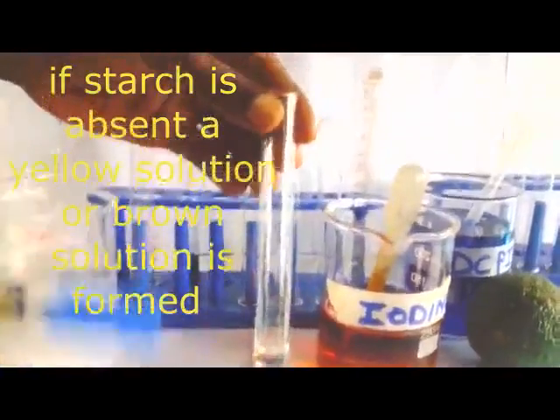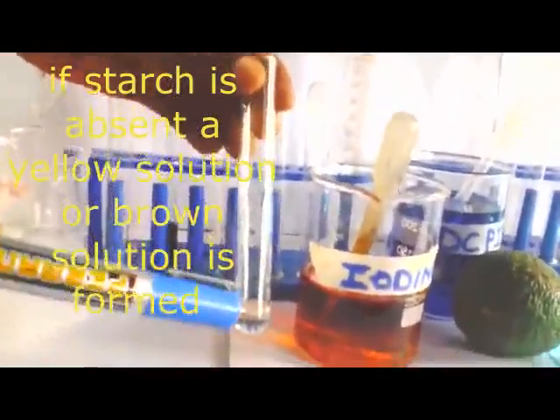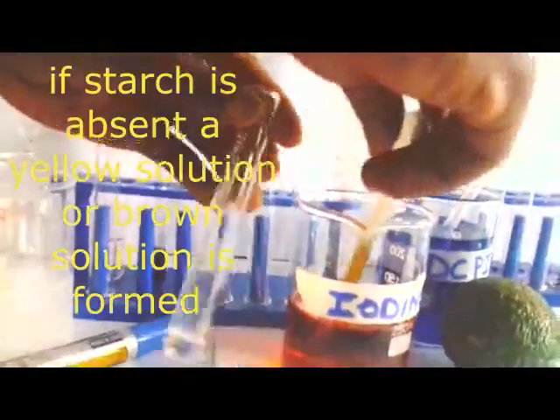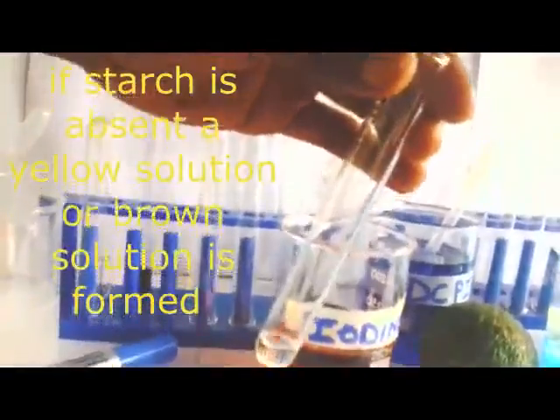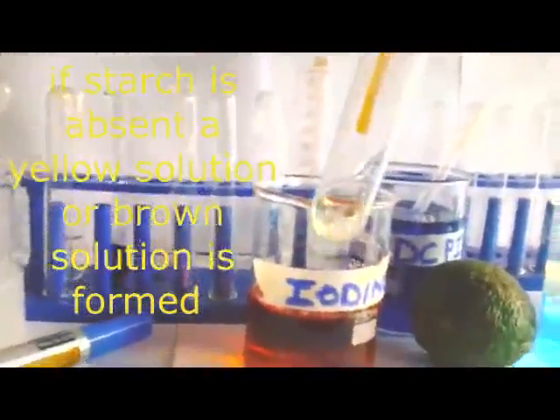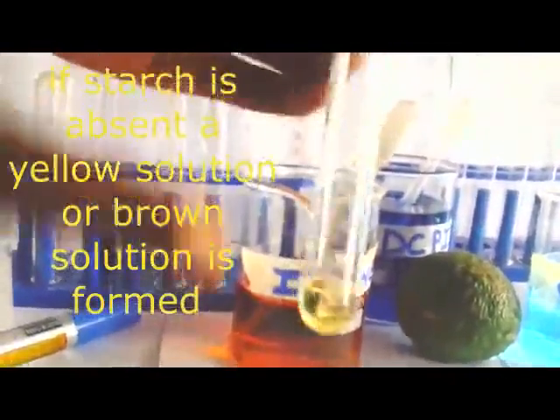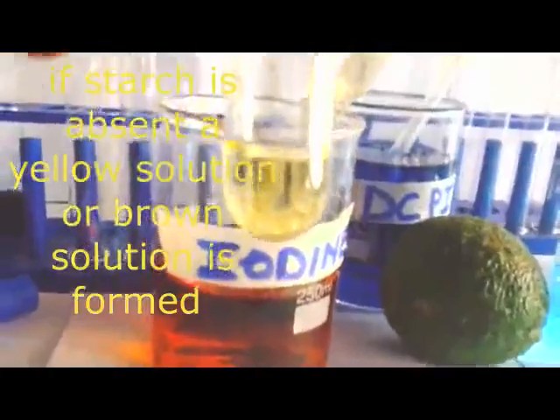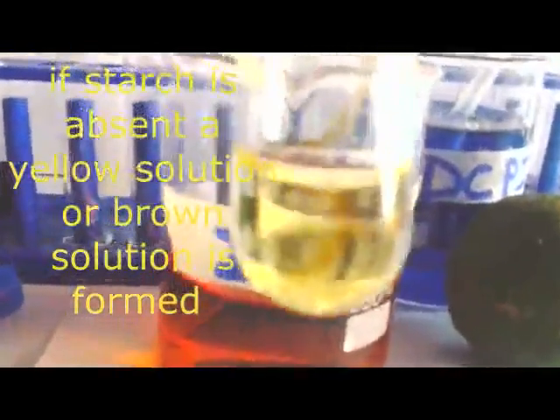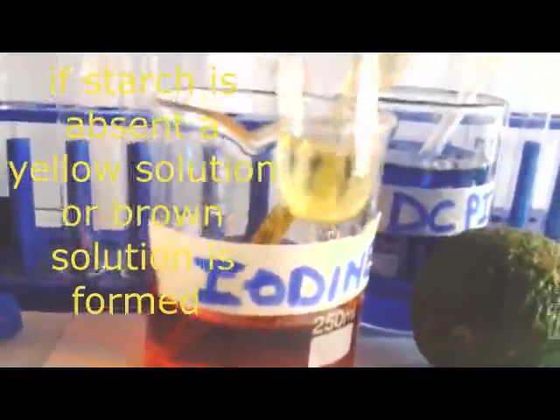Members, I was saying that we can carry out a test which is going to give us negative results. We have used the water here. Then we are going to add iodine and see whether we shall get the same darker blue solution. Then I get my iodine. I put the first drop. You can see that this solution, which doesn't have starch, is just turning yellow. So when I'm recording this one for the water I've used, I will say colorless solution turns to a yellow solution. And there I say starch absent.